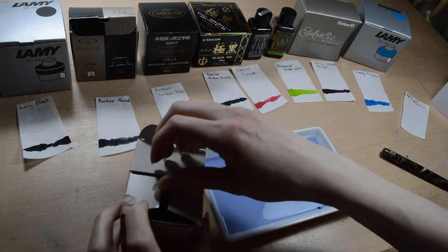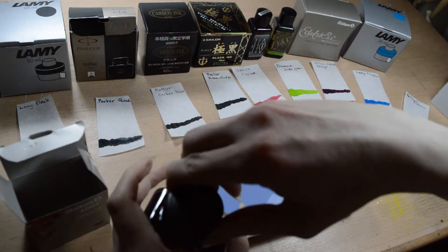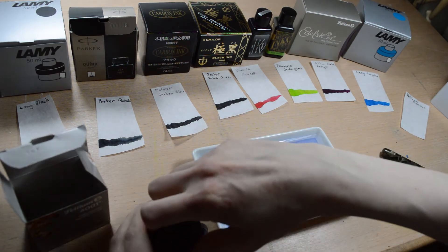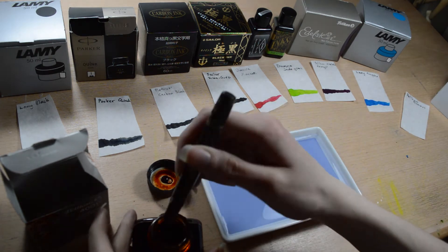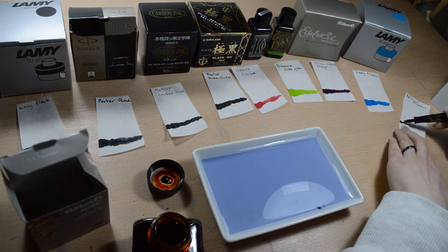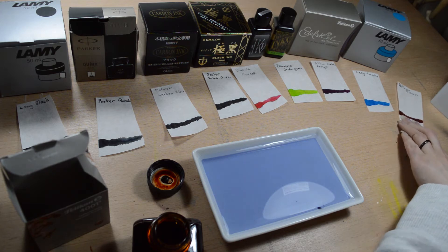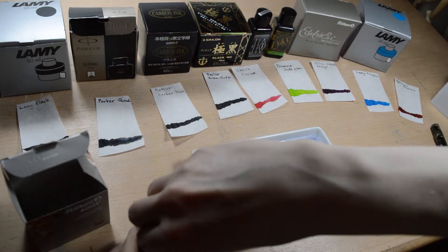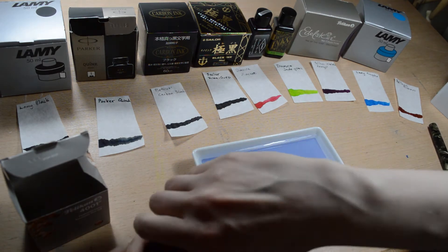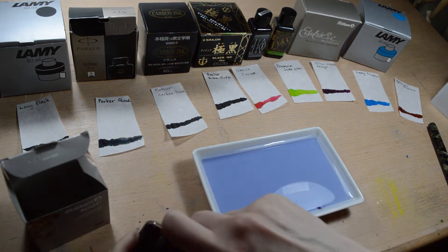And the last one we have is Pelikan Brown. This is quite a nice ink — standard brown color. And now we are going to jump to a time-lapse, and I will show how they react when I dip them into water.